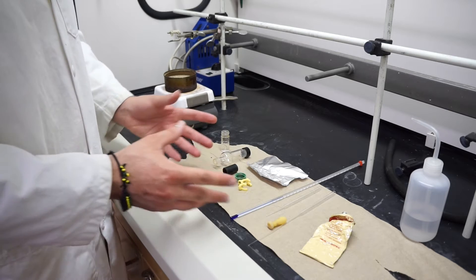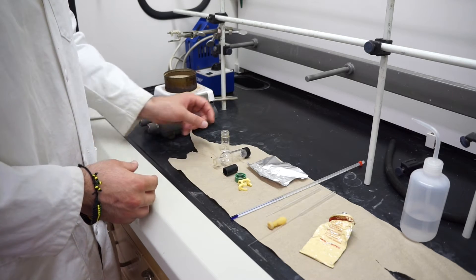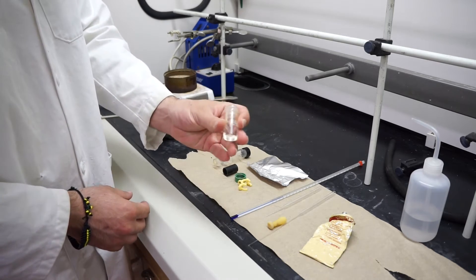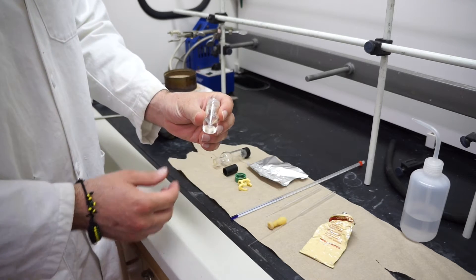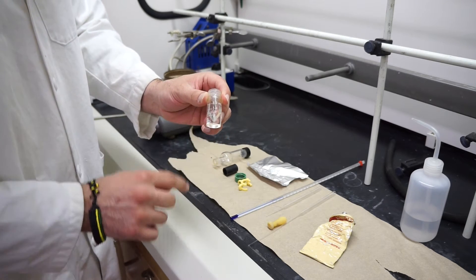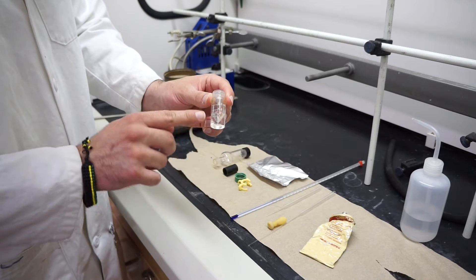Here is pretty much all the equipment that we're going to use today. The first thing that you're going to need is a conical vial. I have a three milliliter conical vial. You can notice the little cone shape at the bottom.